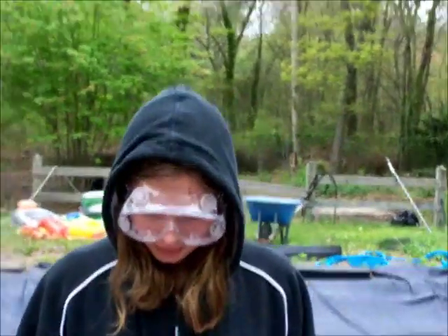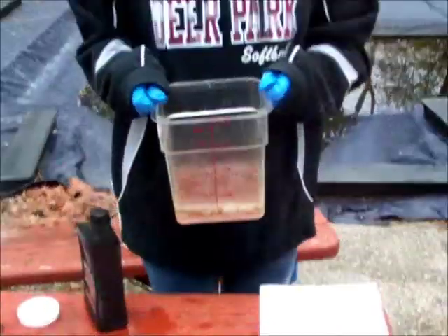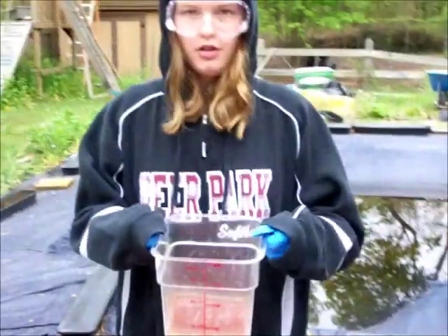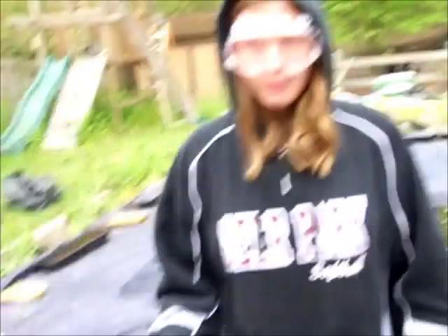That's basically Fenton's Reagent — the solution that I have just created. Normally in real world applications, Fenton's Reagent is used to treat waste water and underground petroleum spills.